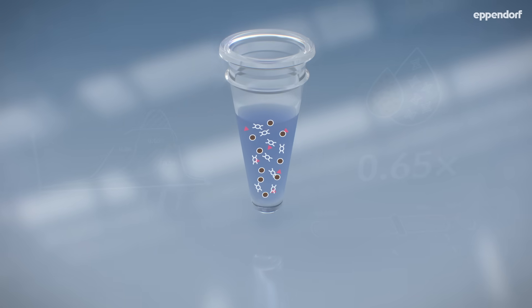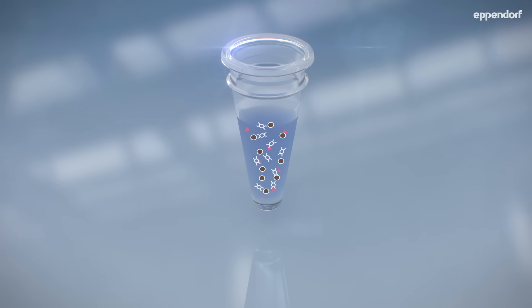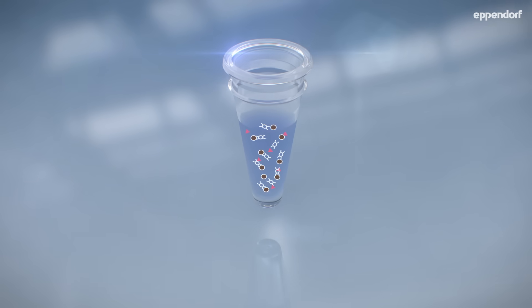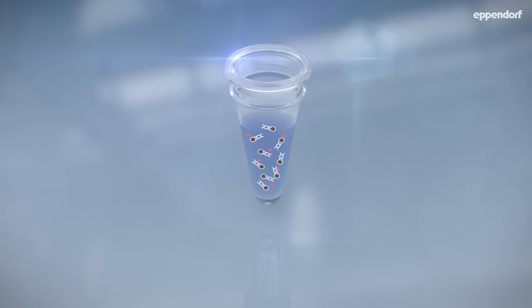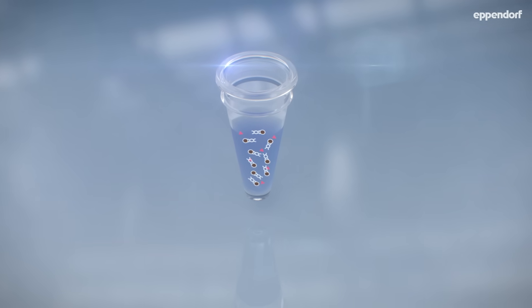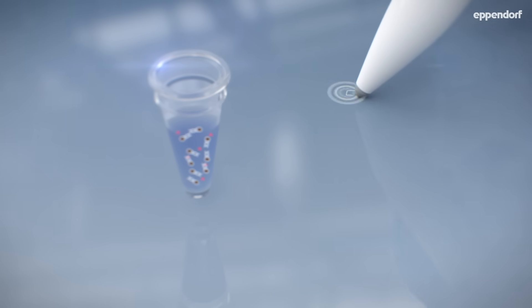Let's move on to the next step. After the incubation of beads and sample, the cleanup process begins. The sample plate goes on to a magnet, where the DNA bound to the beads is separated from unwanted contaminants.